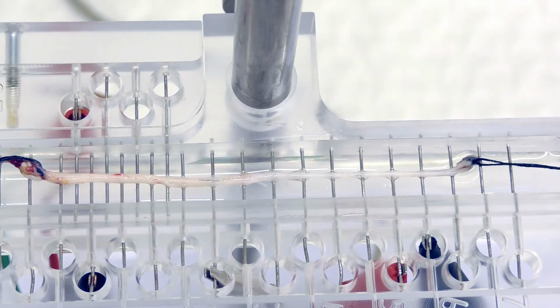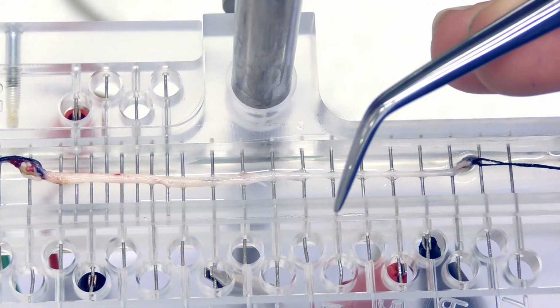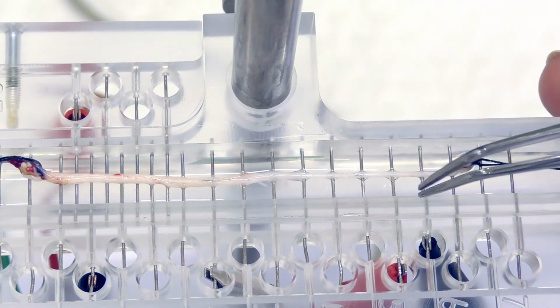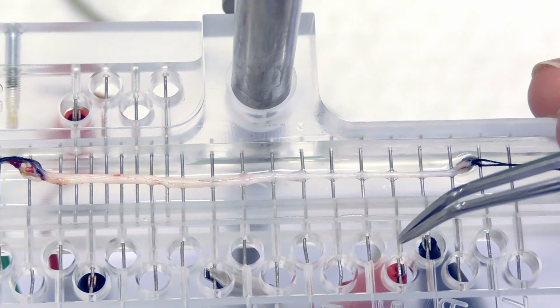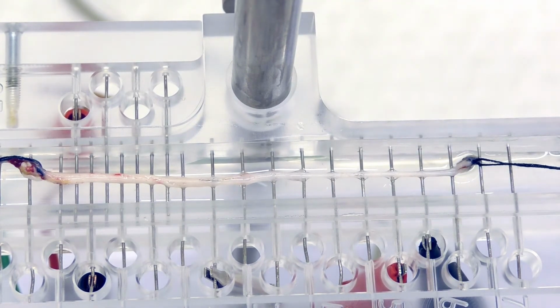So if we come out here to our nerve, we've got the nerve sitting on top of the electrodes of the tissue bath, and down the right-hand side we've got our 2 recording electrodes. Now, to prevent action potentials from travelling between the first and the second recording electrodes, what we're going to do is crush the nerve between those 2 recording electrodes. So that way the action potentials can only travel to the first recording electrode, but because the nerve's crushed, then they can't travel any further along the nerve, so they can never reach that second recording electrode.